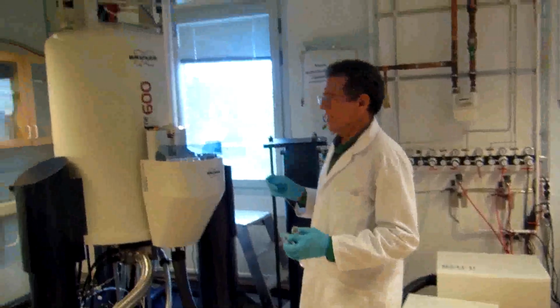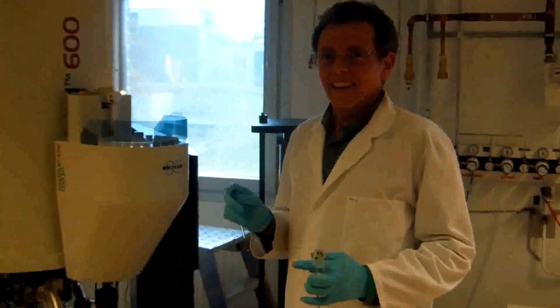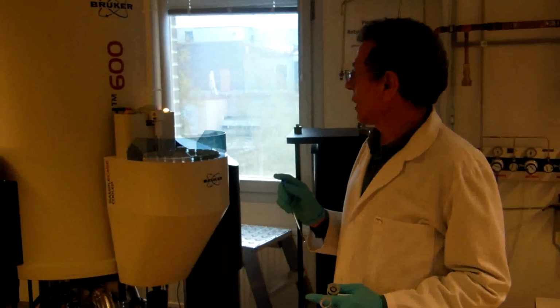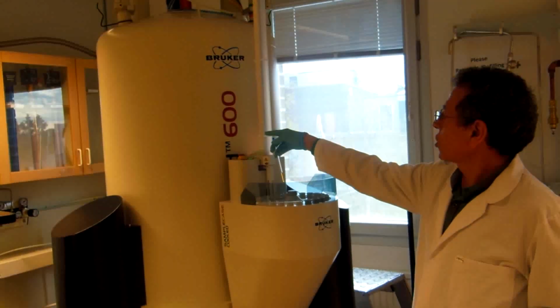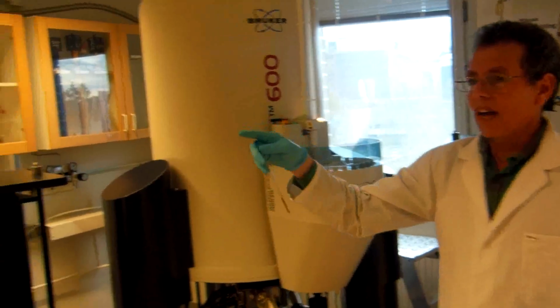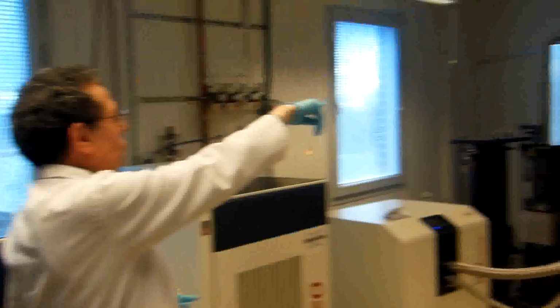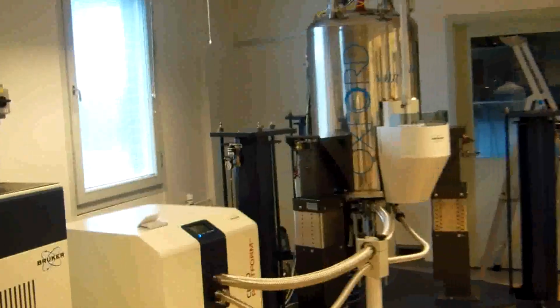So now you can see again our, mashallah, excellent infrastructures of NMR. We have the center of NMR, and in this center we have the machine of 600. This is very, very expensive. We have a 400 NMR machine, and we have also 500. So 400, 500, and 600, and all have the same idea.